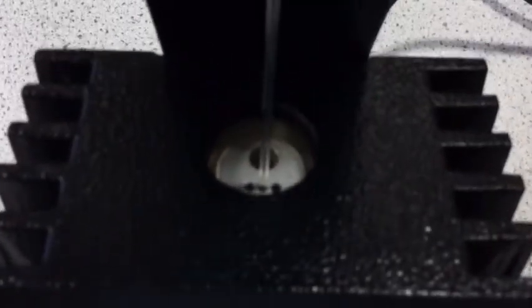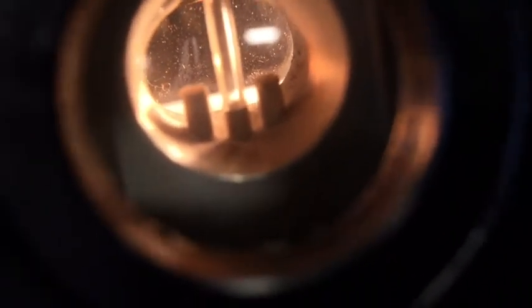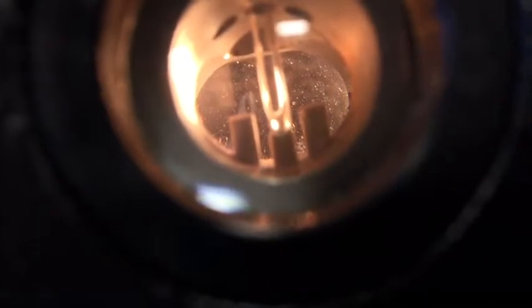So if we put our capillary tube in the middle block and turn the machine on a little bit so the light lights up, and if we put the capillary tube in upside down, at least that's useful for seeing that the bottom of the capillary tube isn't sealed. So I put it in the right way around. Hopefully you can see that the bottom of the capillary tube is sealed, so we can safely put our benzoic acid crystals into that, knowing that they won't spill out.